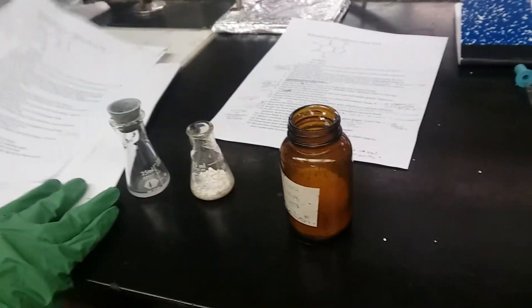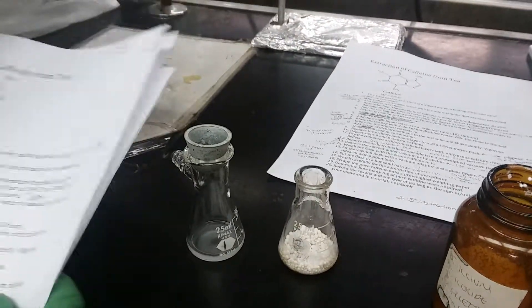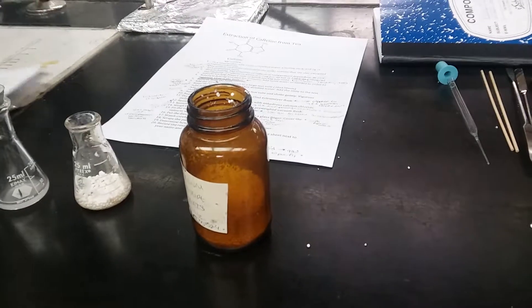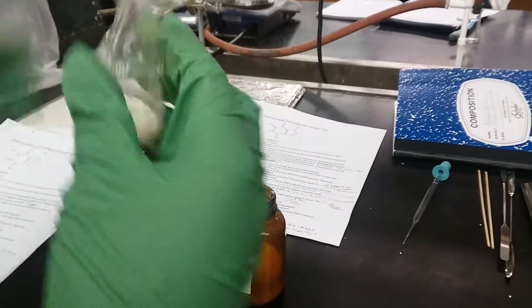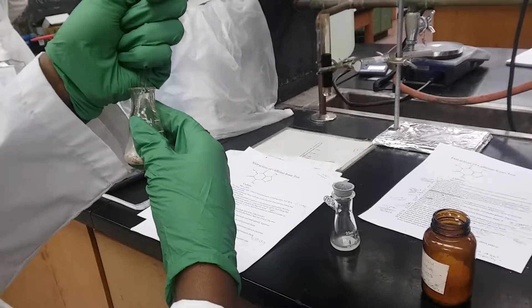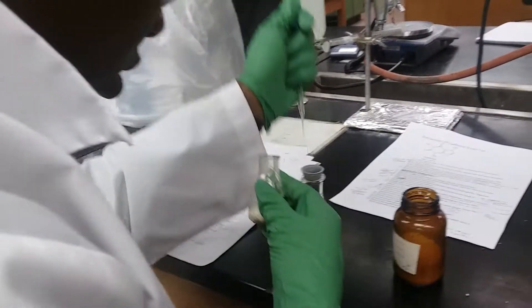So this has been decanted — it was actually vacuumed in with gravity filtration. What's the difference? What did you use? I pipetted it with that. Okay, so you used the pipette. Did you get it all out? Yeah, because — oh wait, actually there's a little bit more in there. Okay, so I get to actually see you do it.